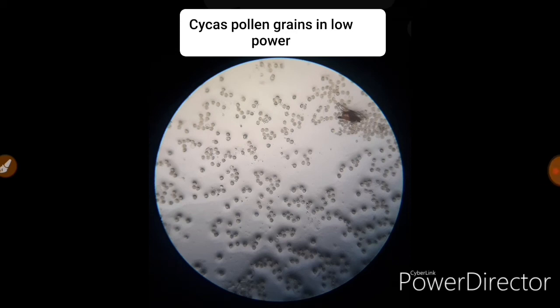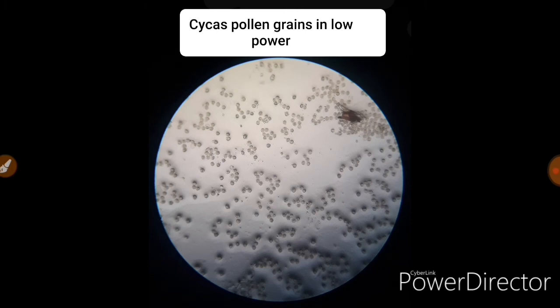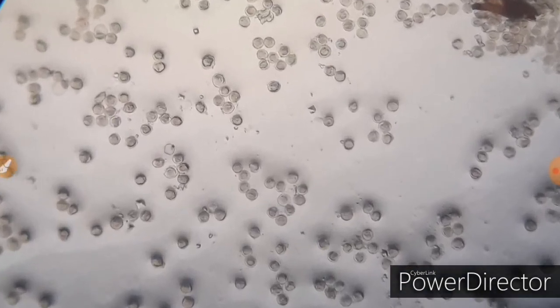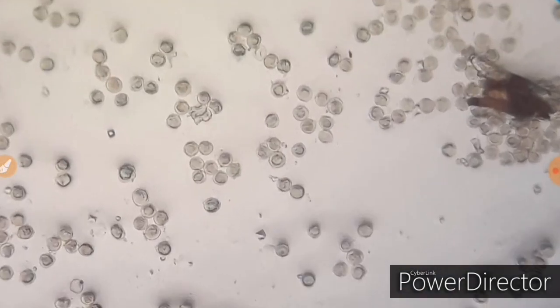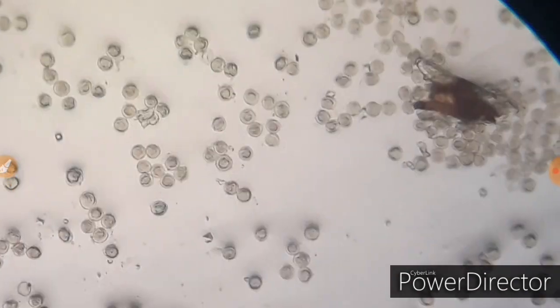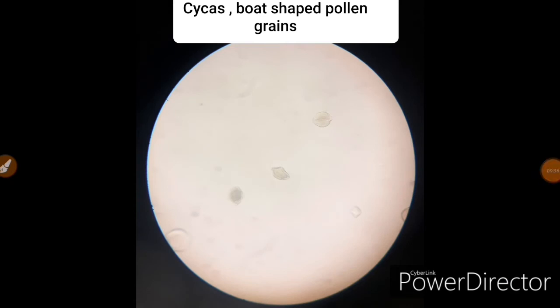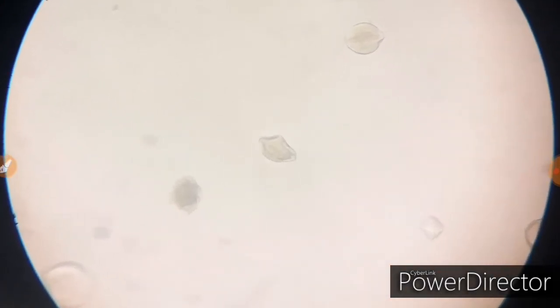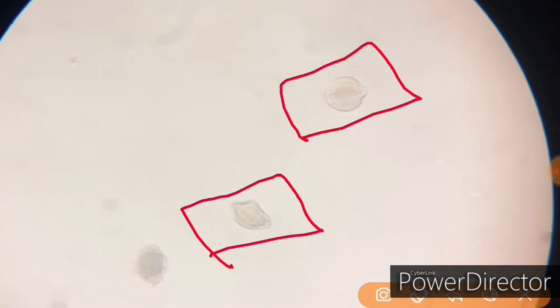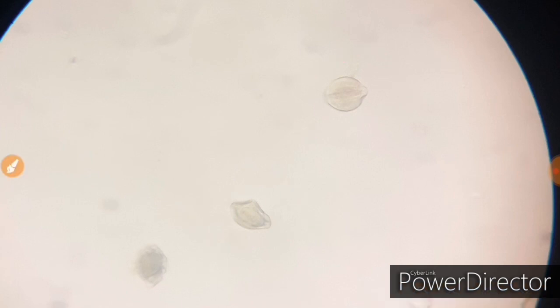These are the pollen grains of Cycas. When you take out a little pollen from the microsporangia and place it on a slide containing glycerin, you will be able to see such a view. In the case of Cycas, we observe characteristic boat-shaped pollen grains — this is the low power view. Under high power you can see clearly these boat-shaped pollen grains of Cycas. What an amazing view!